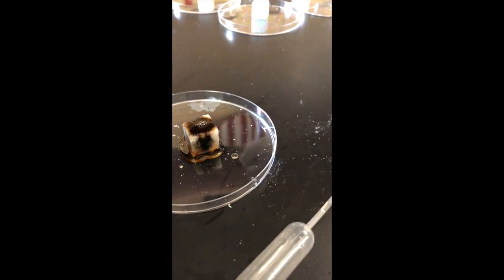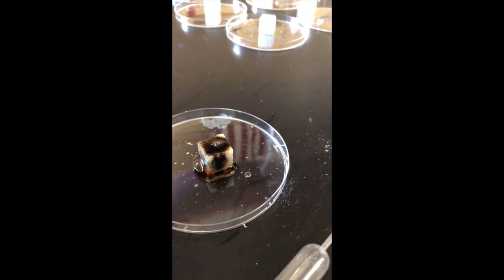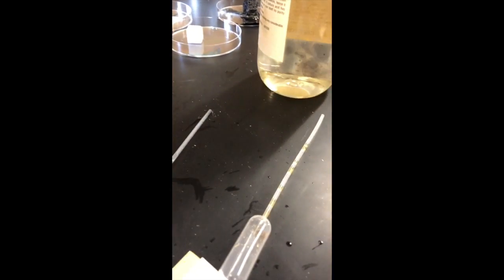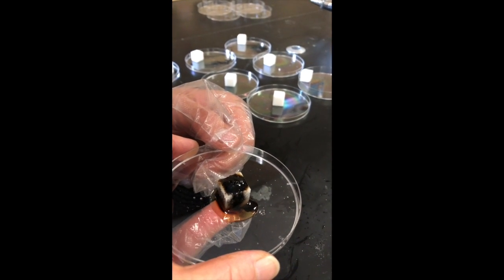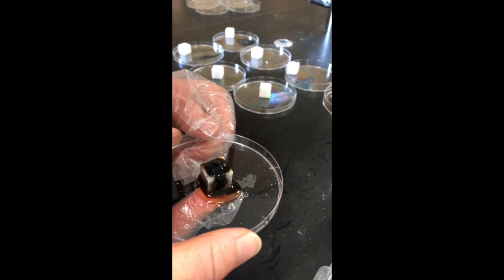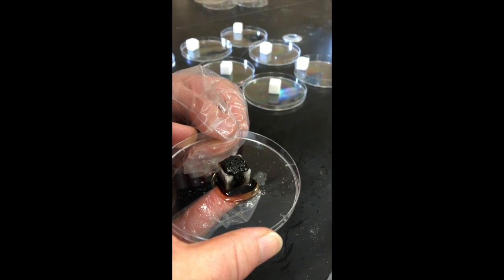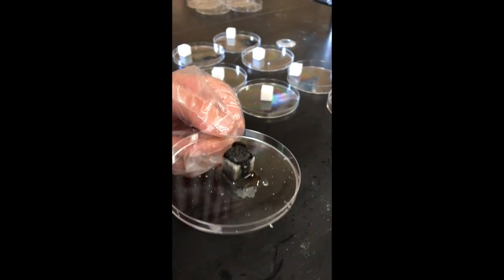So let's take a little bit longer look at it and see what's going to happen to it. Okay, we see bubbles on it. Okay, if you want to, can you take it and touch the bottom of it? What do you note? Anything? Is it warmer? Or not yet? Yeah, it's starting to get warmer. And then you see there's foam.